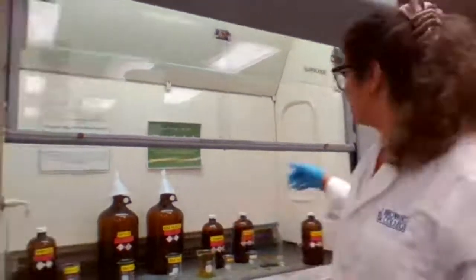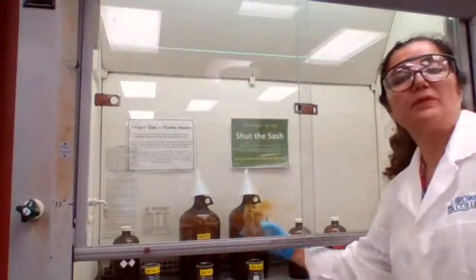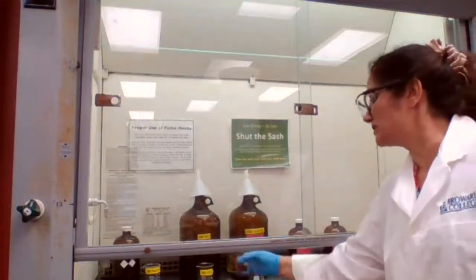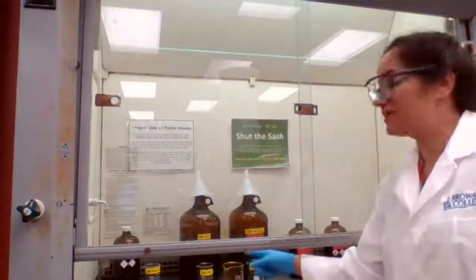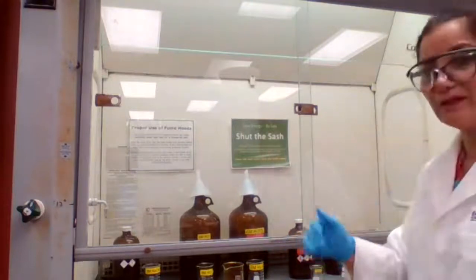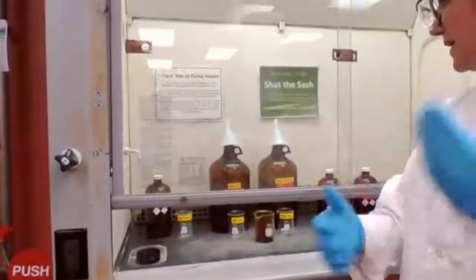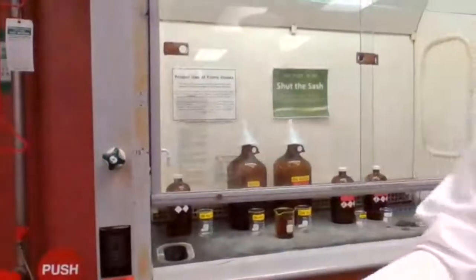So if you see from there, the brown color gas is coming out. It's a very toxic gas. It has to be done in the fume hood. The fume hood is not acting strong to me at this point. Otherwise, it should have just pulled it up. So we have that brown color gas. We're going to leave it there until that reaction is complete, because we don't want to bring the beaker out and inhale the toxic gas.